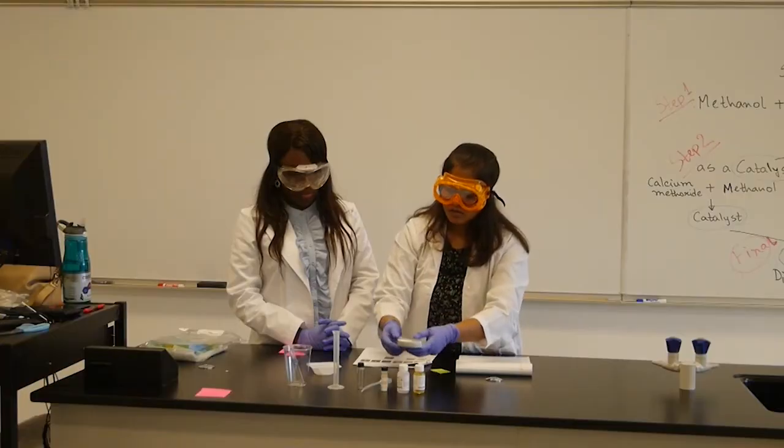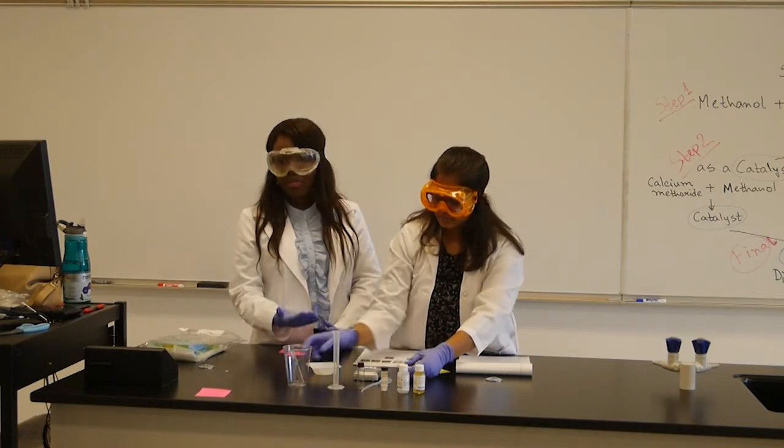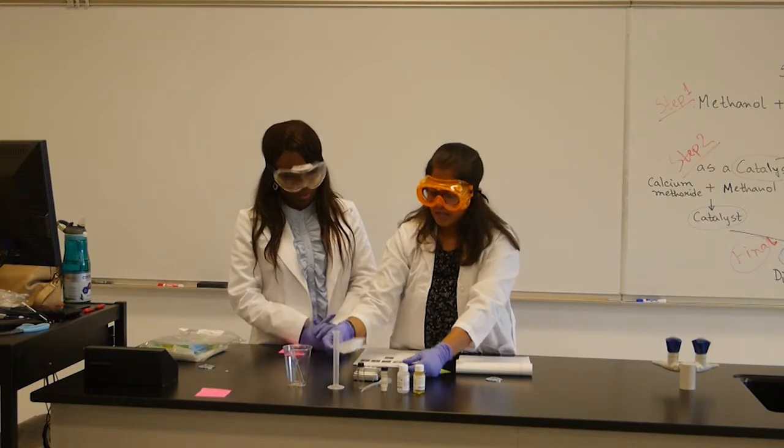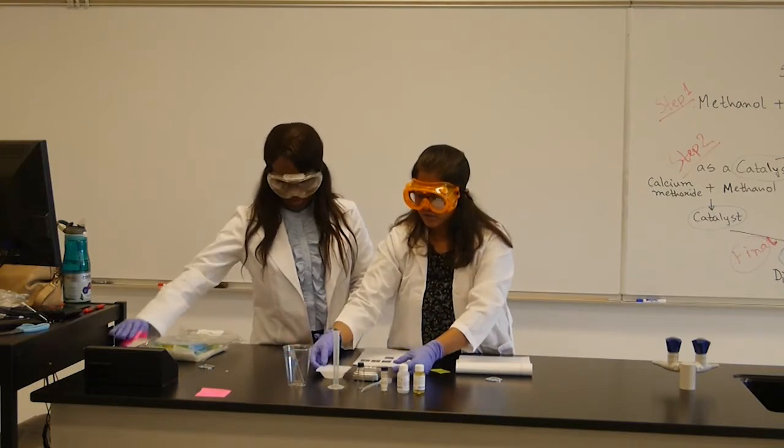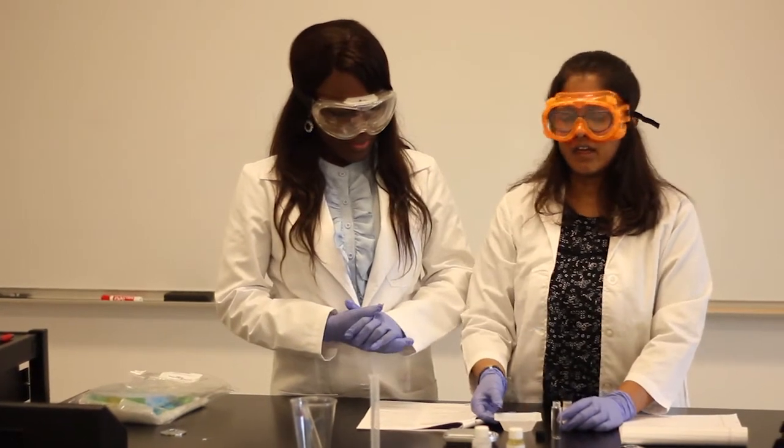With the weight balance—and this came with a battery, we're ready to put in the battery—it should be available. We're going to go ahead and start with the lab activity.